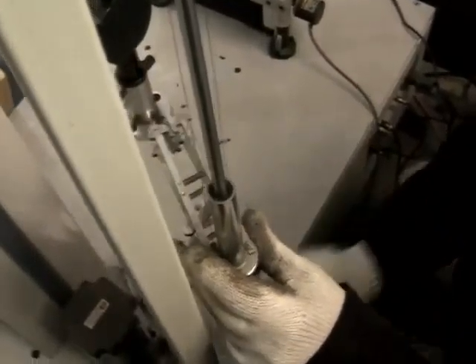And we will bring the measurements to the sample.